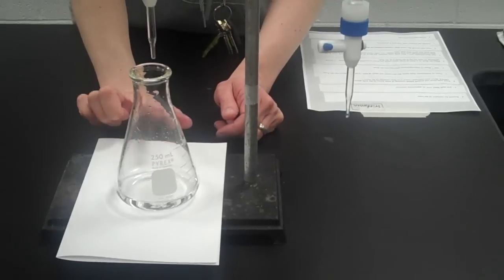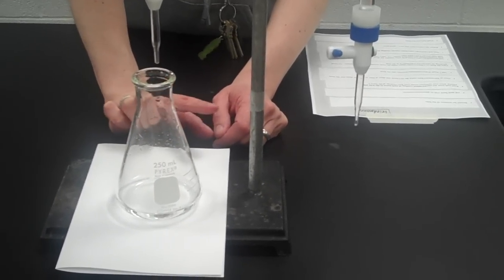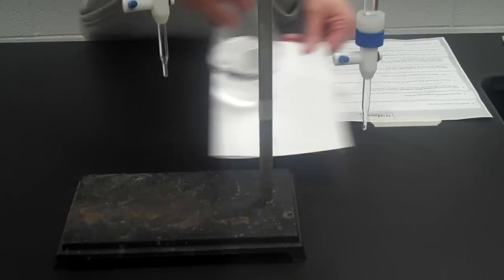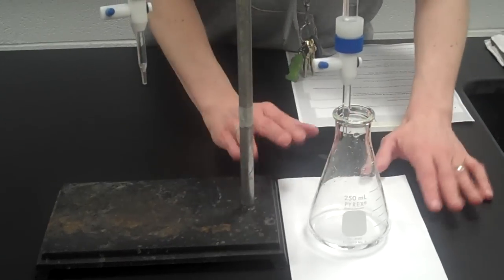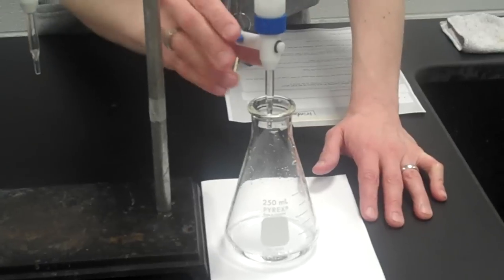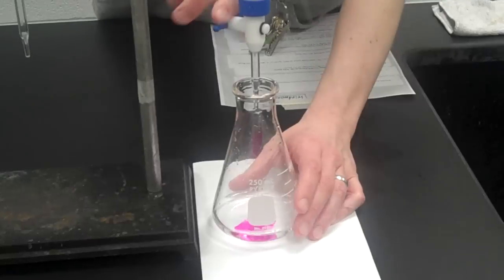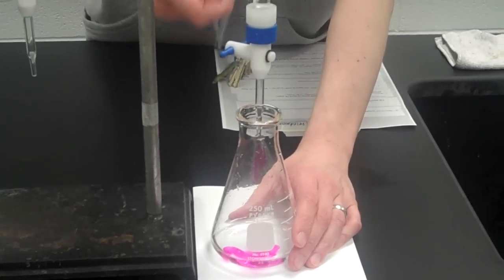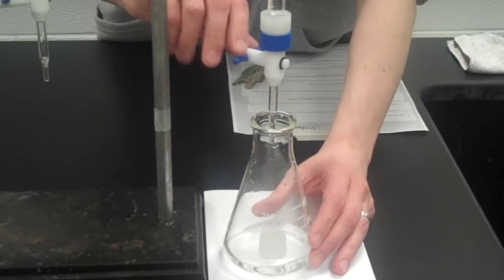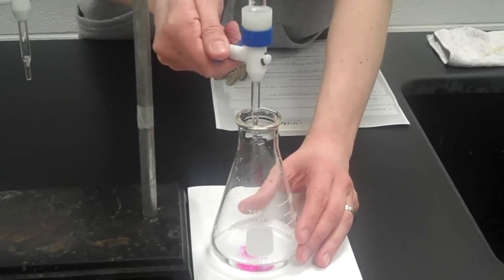Okay, now I know I'm very, very close to my end point, the point where the amount of base is equal to the amount of acid in moles in my solution. So what I want to do is add base, but I don't want to add so much base that I overshoot it again. The way to add a tiny little bit using these burettes is not to go like that, because you can't ever turn the valve up and turn it back again fast enough to avoid overshooting, although it looks like I did there. The way to add base just a little bit at a time is to flip the valve quickly, like that.